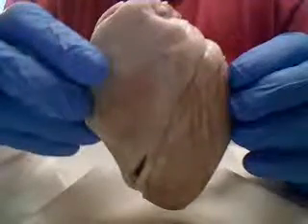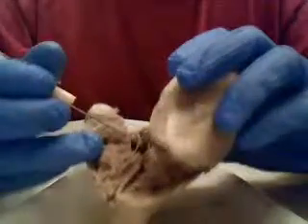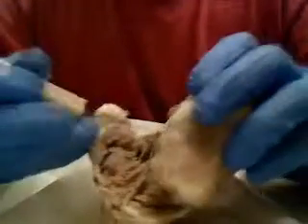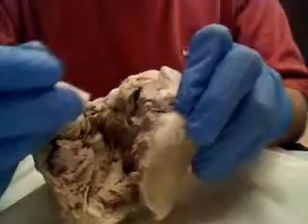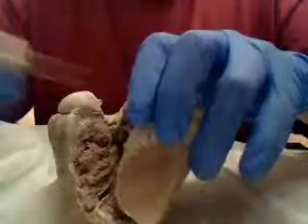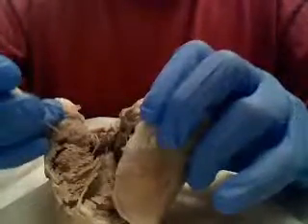The next part is the internal anatomy of the heart, so I'm going to go ahead and turn it around to where I cut it down through the center. Now starting on the left side, in the inner wall of the right atrium, we've got the pectinate muscles. Now the next part is the myocardium, which is on both sides over here. And the myocardium on the left ventricle is actually 3 times thicker than the right ventricle, and that's because the left ventricle actually pumps blood throughout the entire body, so it's pumping a larger blood supply.